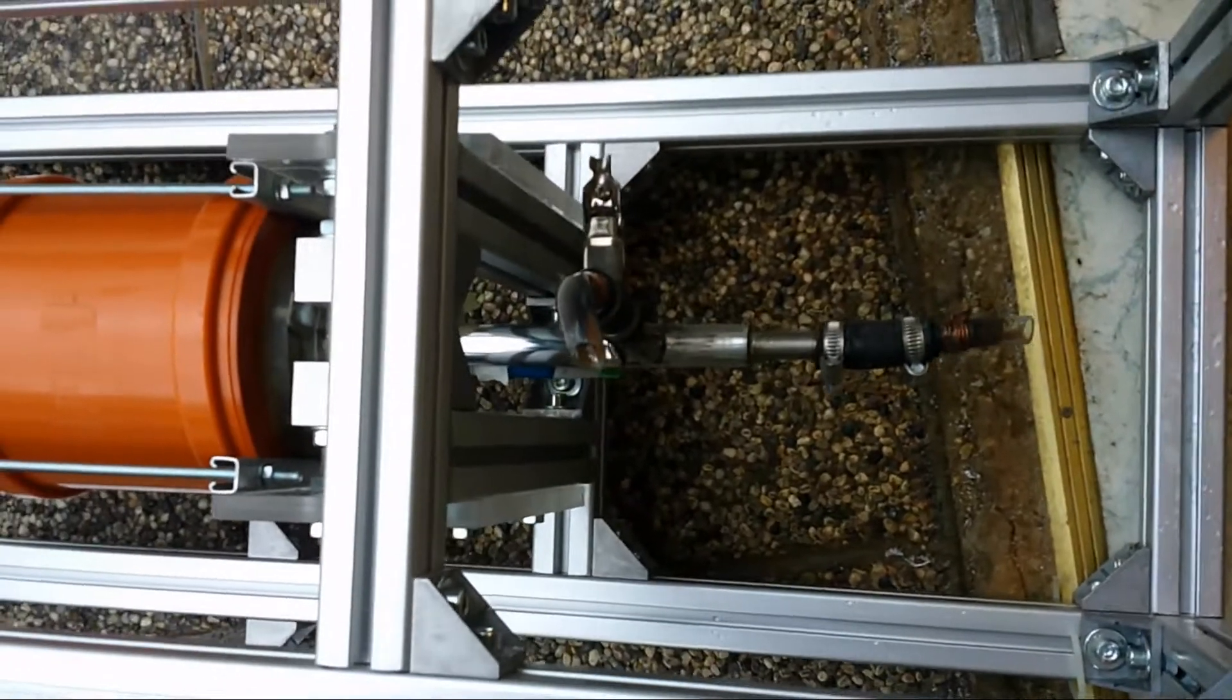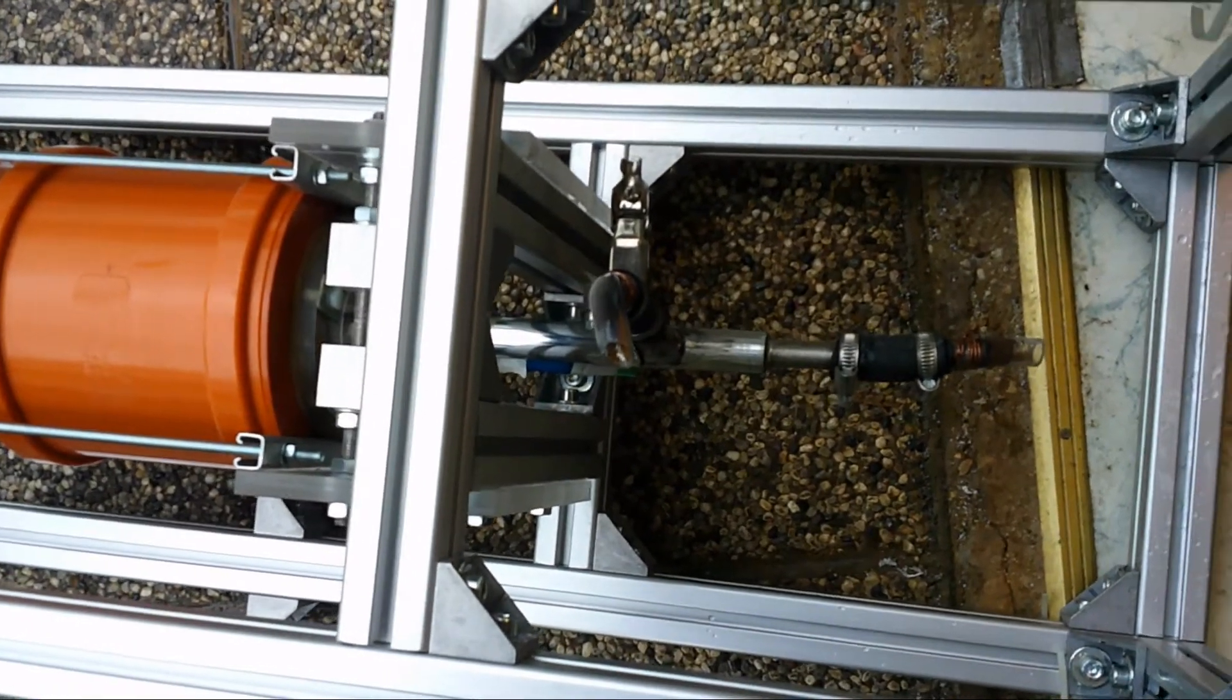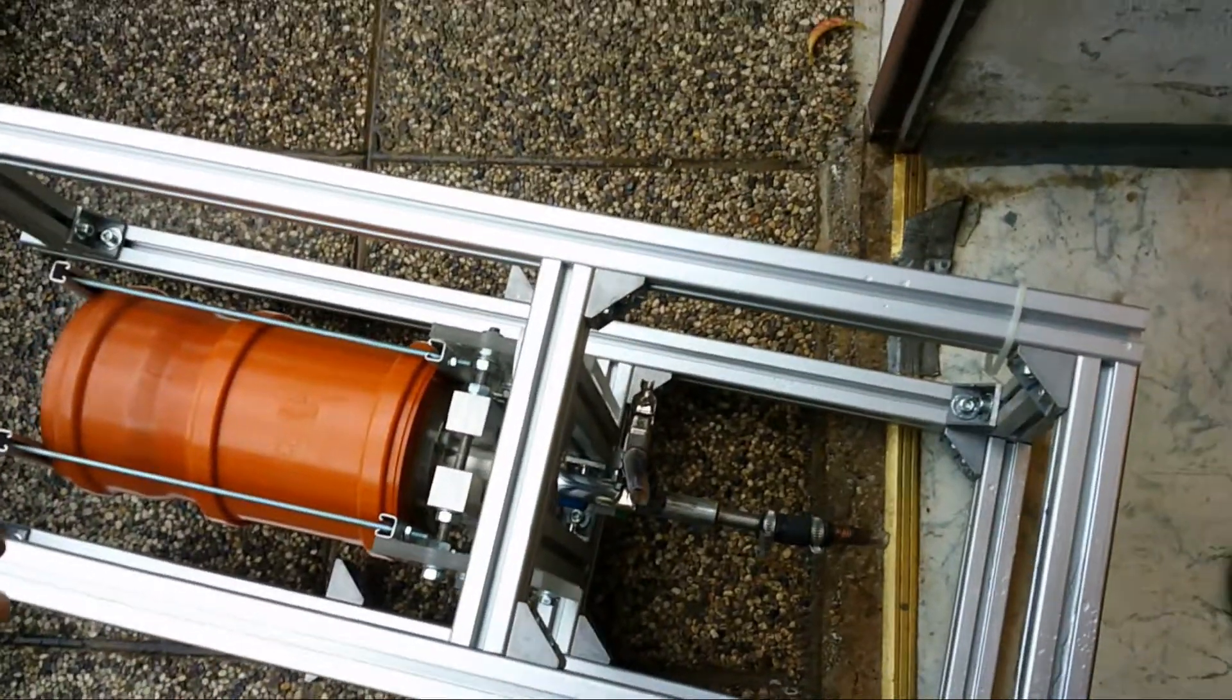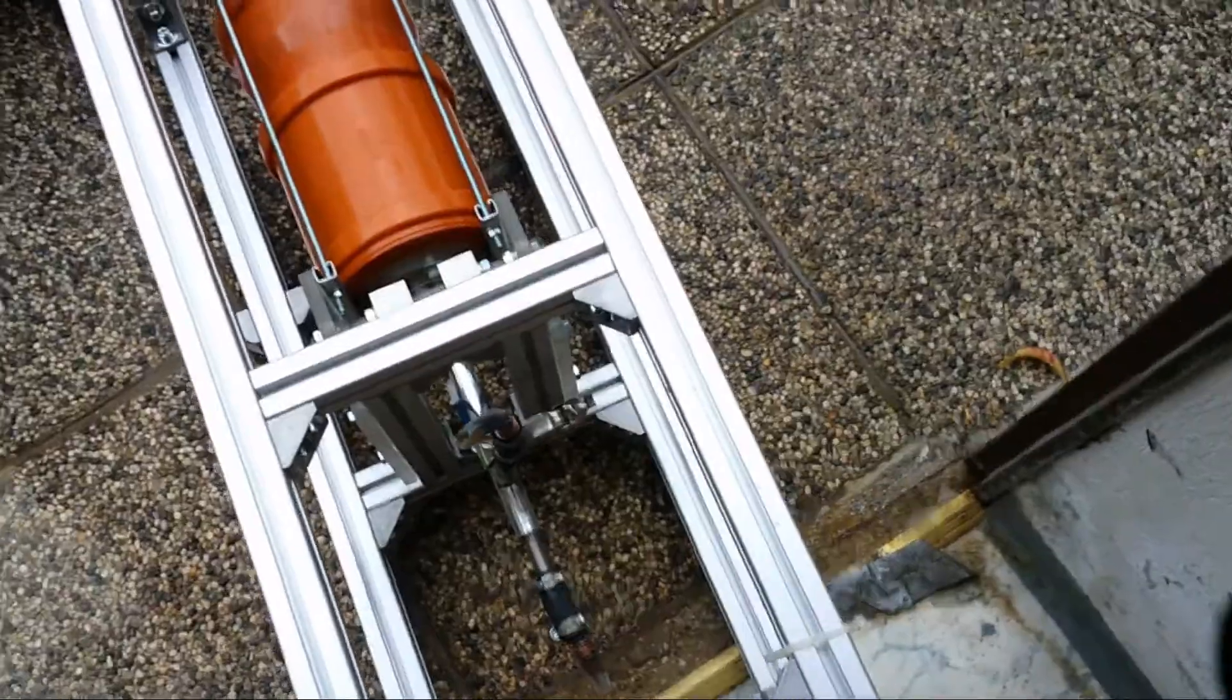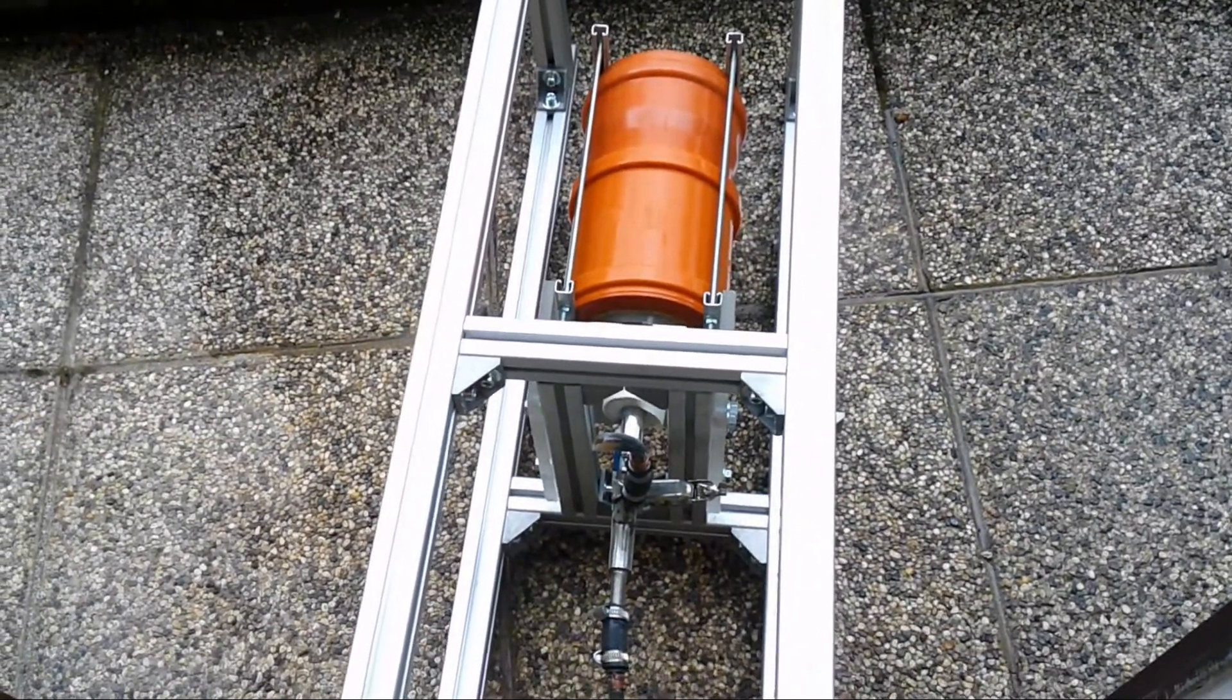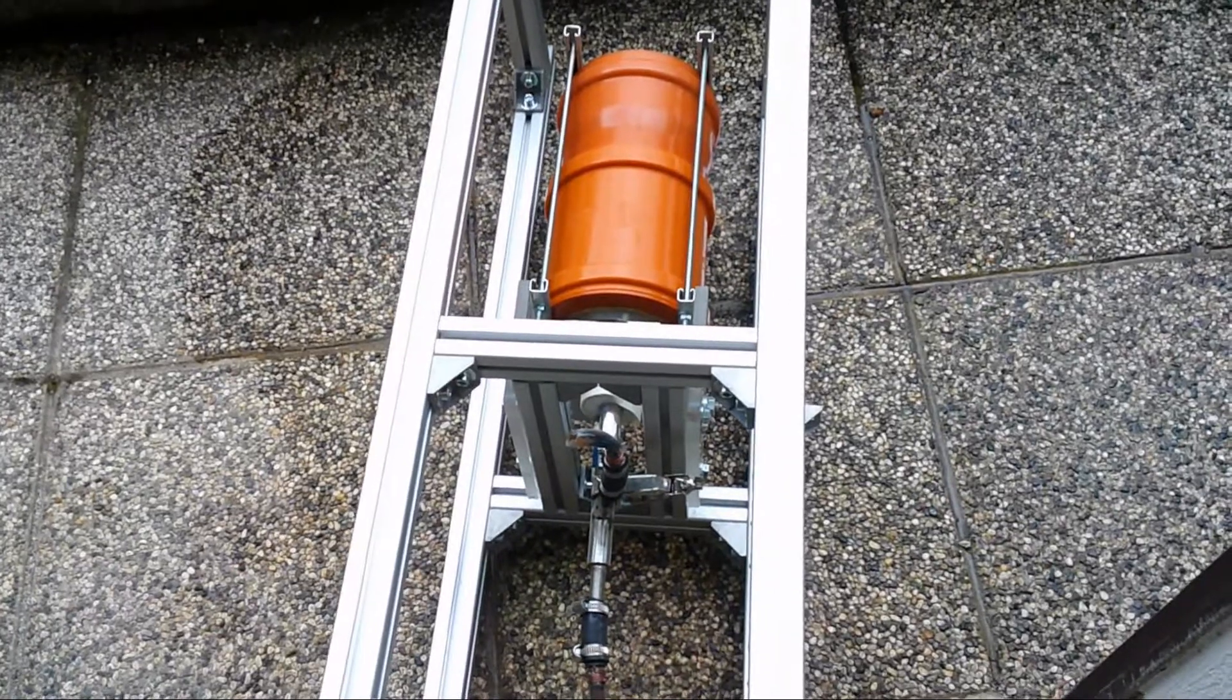Between those two electrodes there is a high voltage arc, and that is what is creating the NO2. And now I am going to completely disassemble this thing to see what is inside.